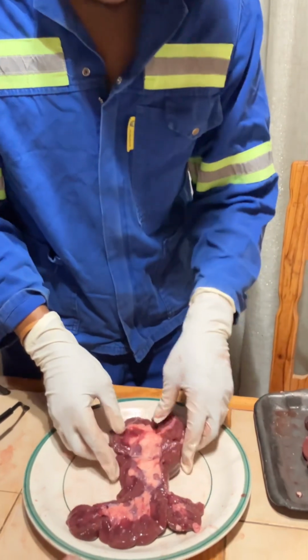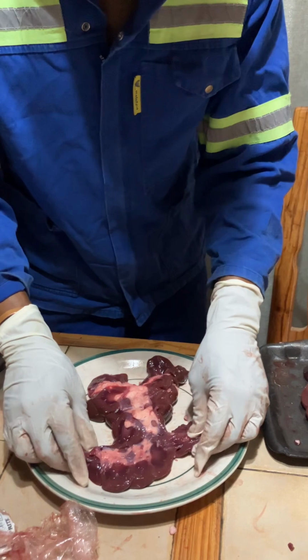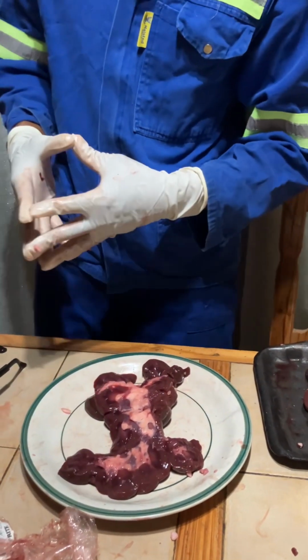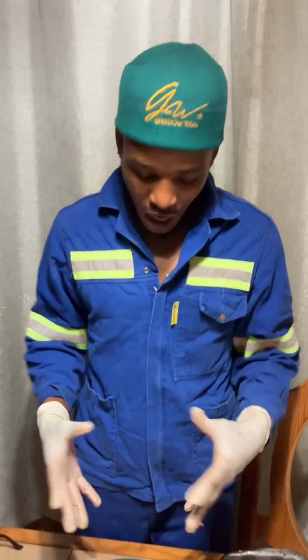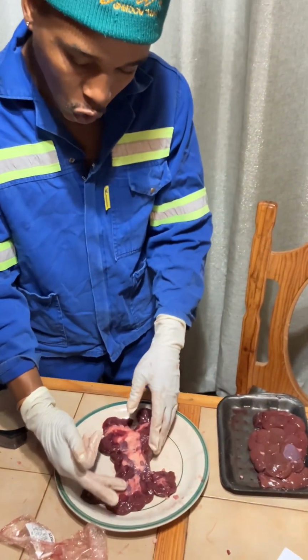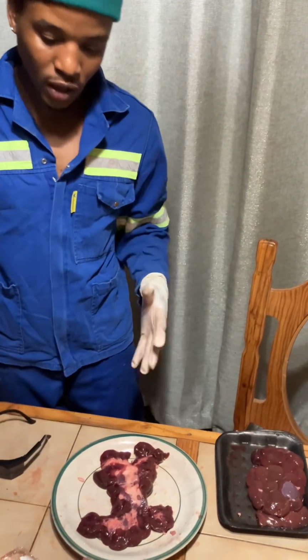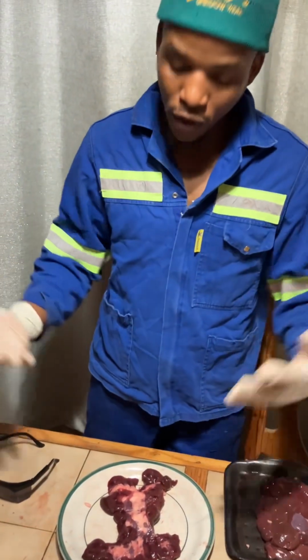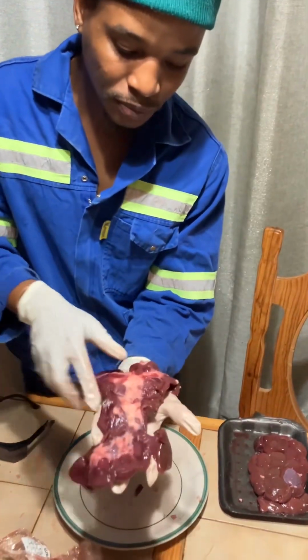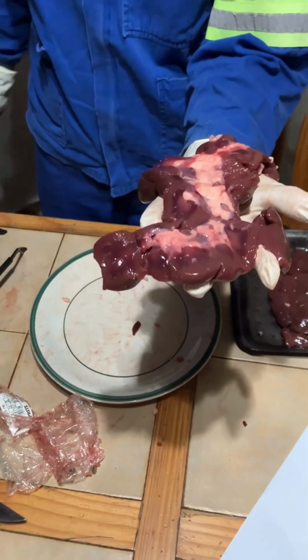Okay, now as we dive deeper into the presentation, we find that our kidney has some sort of triangular shapes. Those triangular shapes are called the renal pyramids. Now, the renal pyramids are the ones that transport the urine through the nephron and the renal tubules. So all of these organelles work together during the filtration of the liquid or the fluid as it enters the kidney.